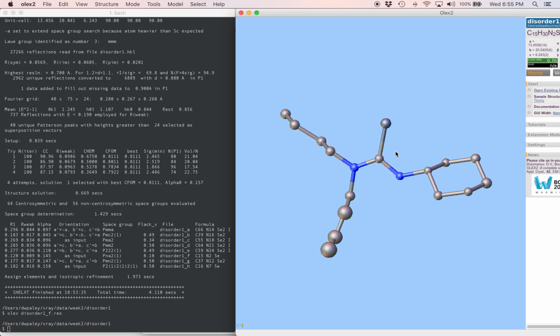I'm going to start by naming these atoms and then I'm going to sort them. So this is going to be C1. This is selenium 1. We'll do the right side next and we'll start from 11. This is using mode and name like we did before. I'm going around the ring in order.